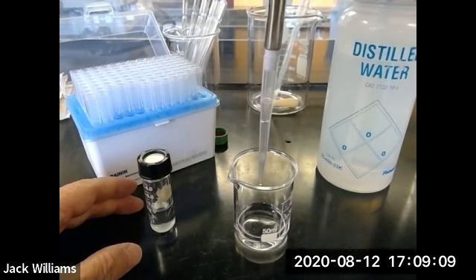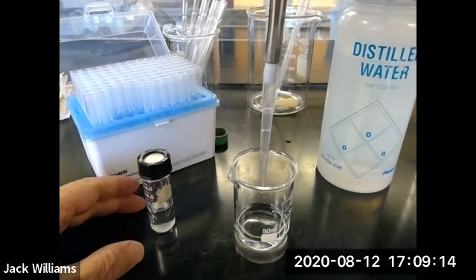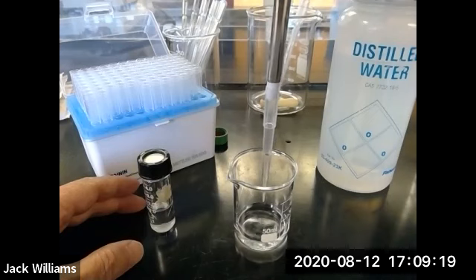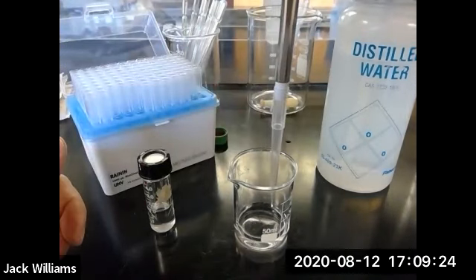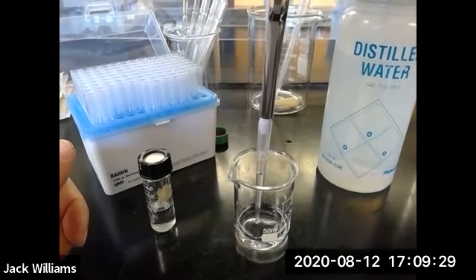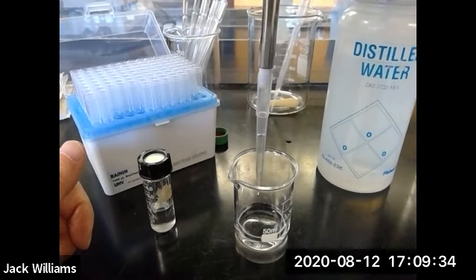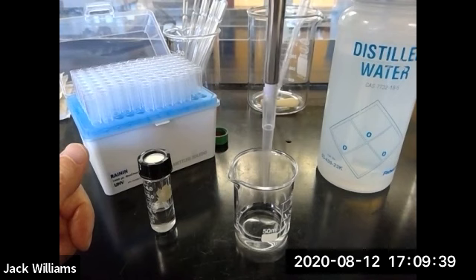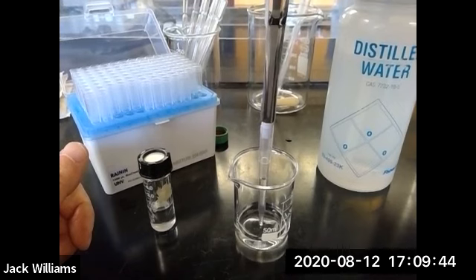Perfect. Look at that, no dripping. And that's because the vapor pressure of water is a lot less than the methylene dichloride. So usually you don't have that problem. But just to make sure I've wet the inside with water, I'm going to do this a couple of times. This will be especially important when you do oils. Oils have a tendency to cling to the inside of the pipette, and therefore you want to make sure the pipette is well rinsed with the oil.